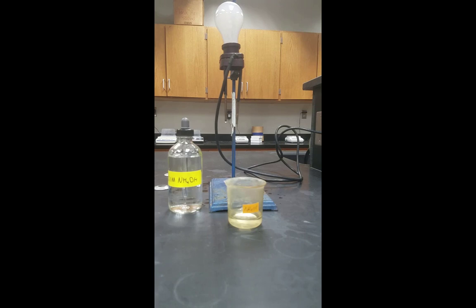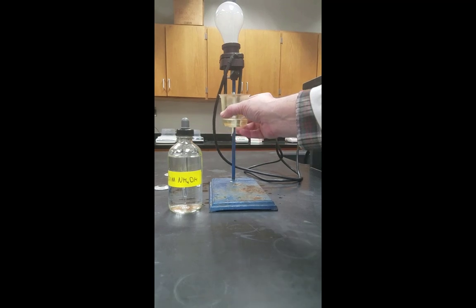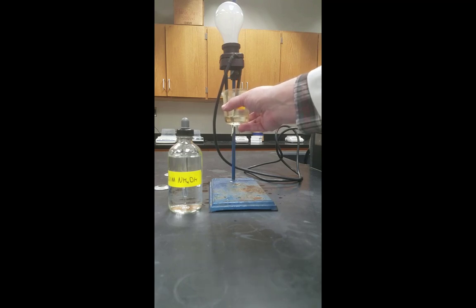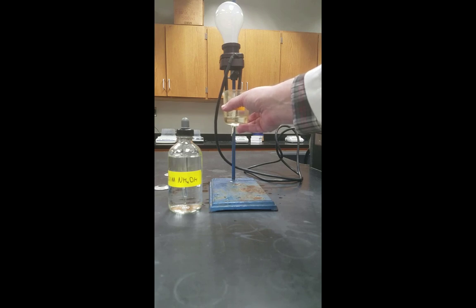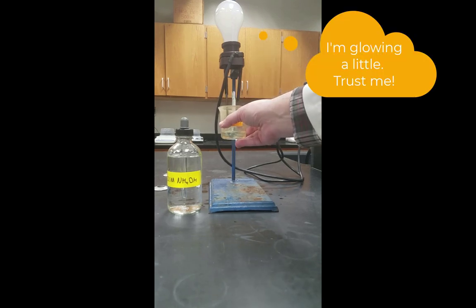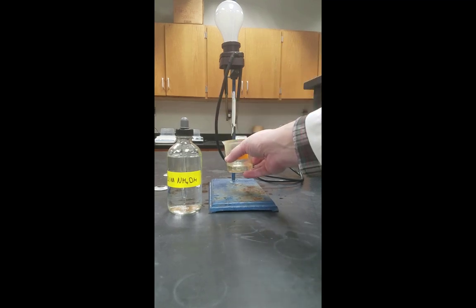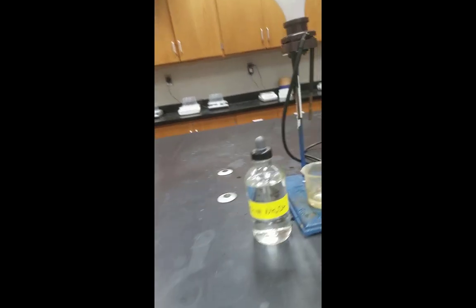This is ammonium hydroxide. It's probably the trickiest one to test. Watch the center of the bulb very, very carefully. And if you see, there might be a little line suddenly pop up inside the bulb, like right there, I think it happened, and then disappears. So you might have to take my word for it on this, but it is glowing very, very dimly.